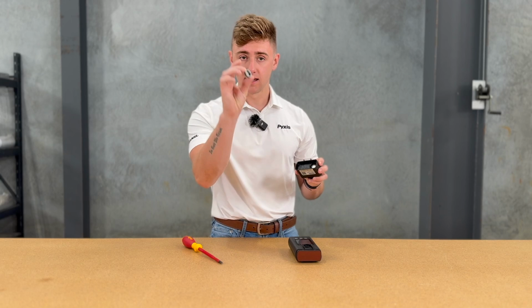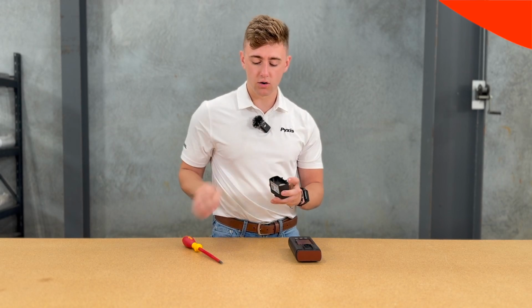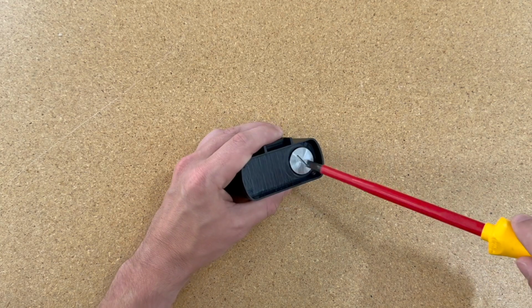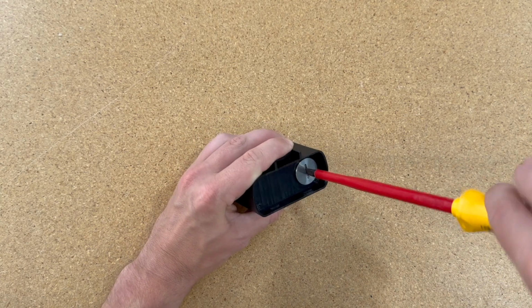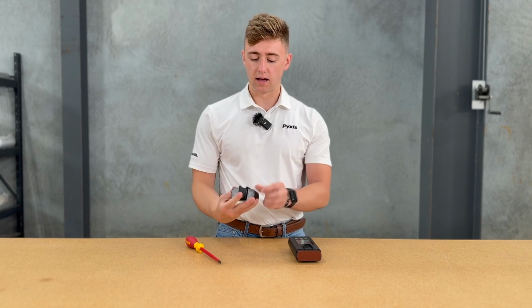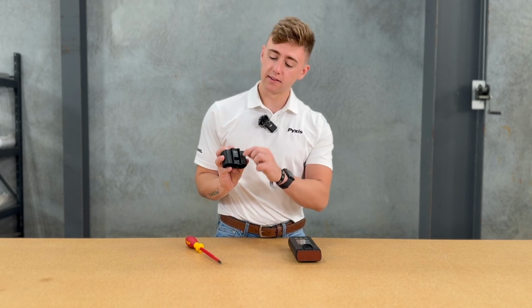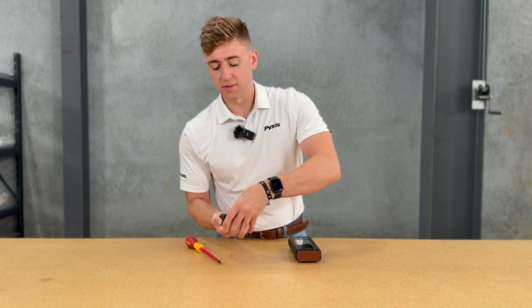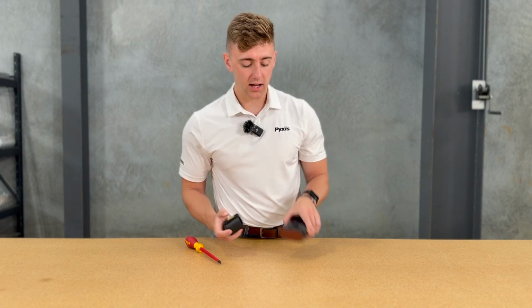And then we're going to take our compartment again, place it directly over top of the battery, and just simply thread it into place and go until you can't do it anymore. So that way it's nice and water seal tight. Boom. And now we're ready to go. I've even got a green indication light on the top of the pH ORP module that shined at me a little bit to tell me I did it correctly and this guy's ready to go.